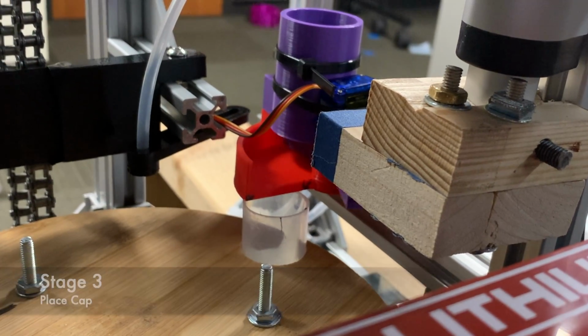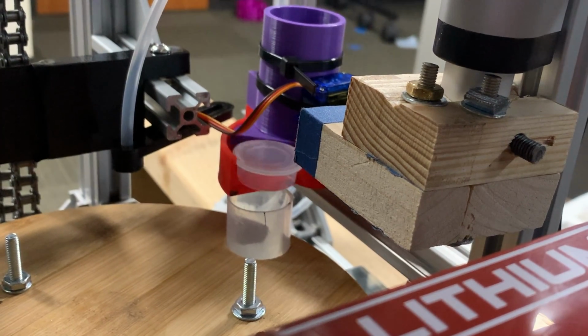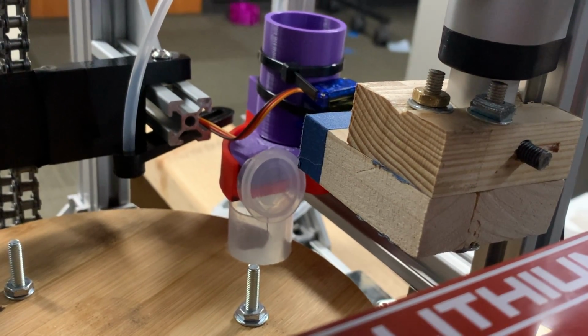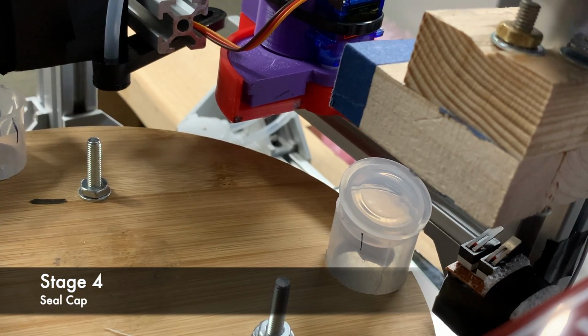This part of the device was created using 3D design and printing techniques. It uses a 5-volt DC SG90 servo motor to drop the cap and then slide the cap over the sample tube. The last stage is the cap sealing stage.